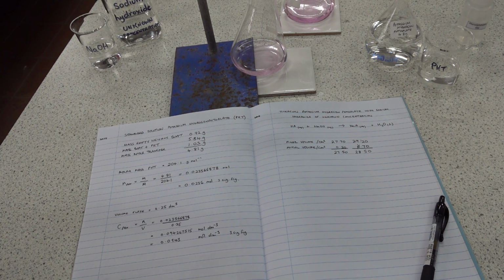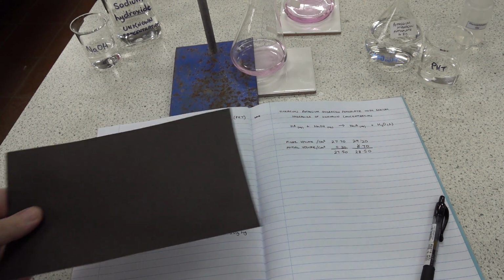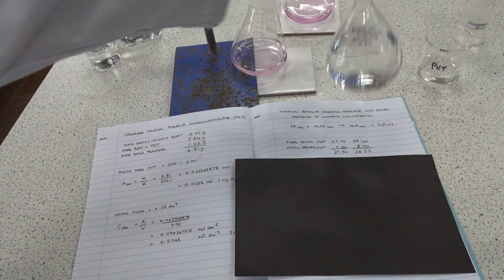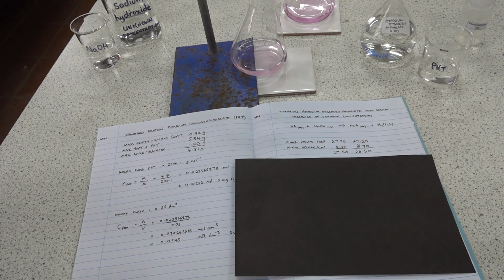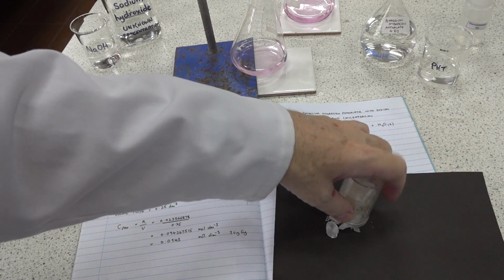Now, potassium hydrogen phthalate is a rather nasty chemical in terms of the environment. It has numerous problems associated with it, and the problem with it is we end up with a set of solutions like this that are then discarded. If one crystallizes out the material, you can begin to see the problem of the amount that's going into the environment.